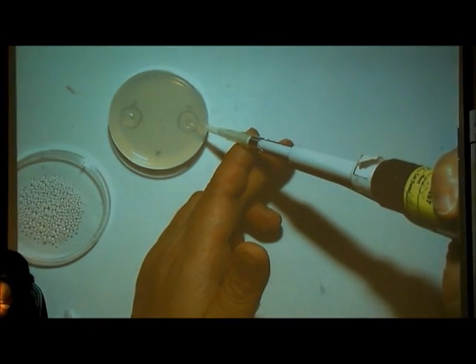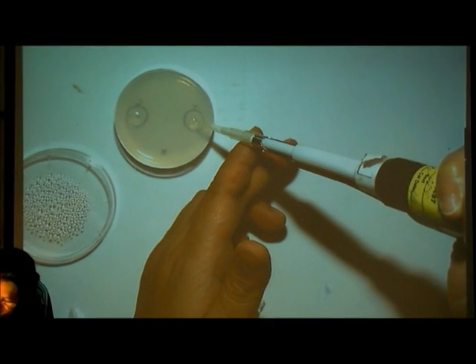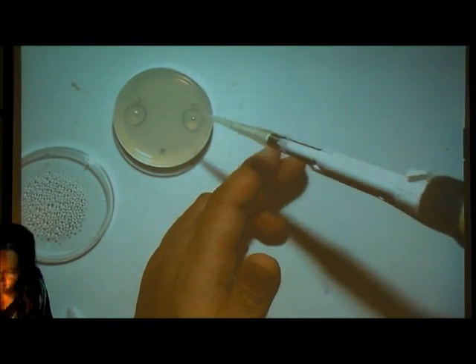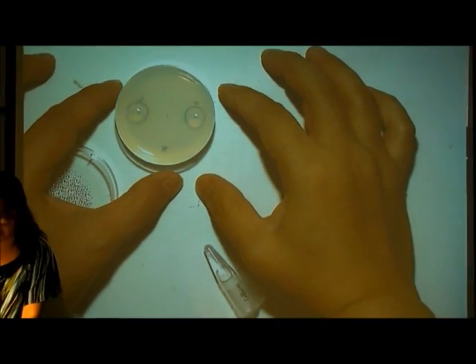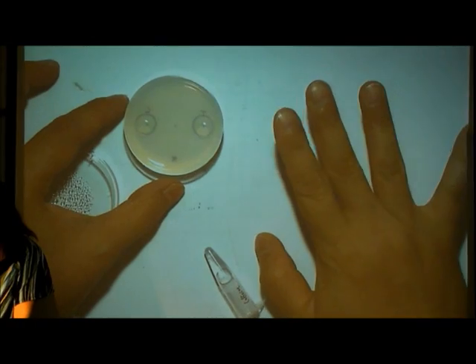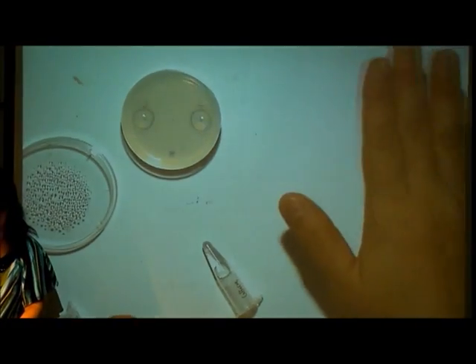So again, I'm pulling it slowly. Nice to do it. So there. And now you have to wait until the liquids dry out. Put it in the same place. Don't shake, and make sure the surface is horizontal.